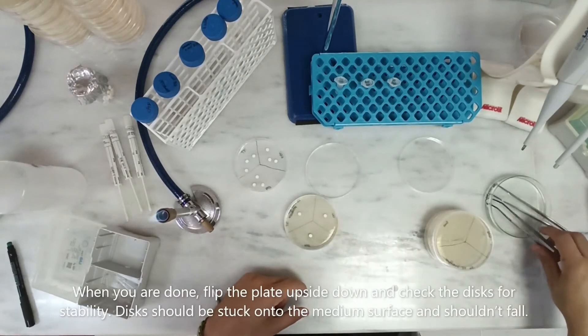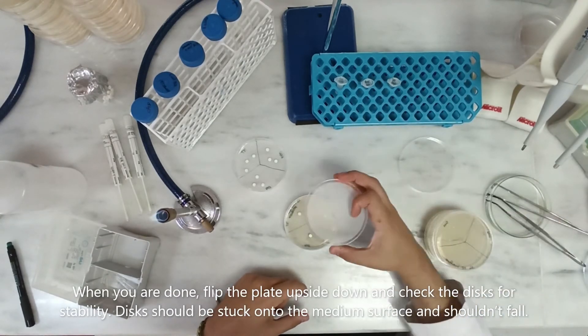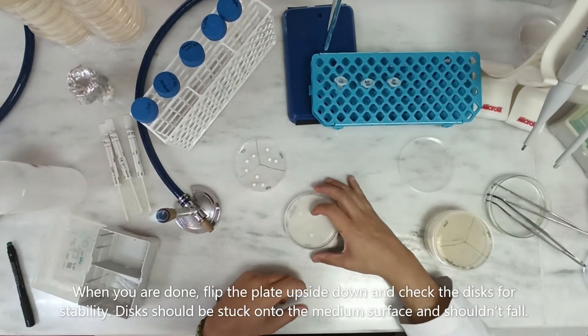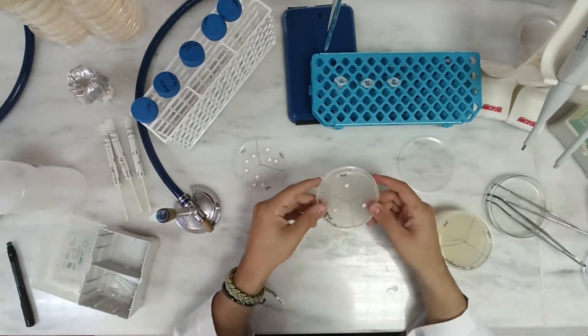When you are done, flip the plate upside down and check the disks for stability. The disks should be stuck onto the medium surface and shouldn't fall.